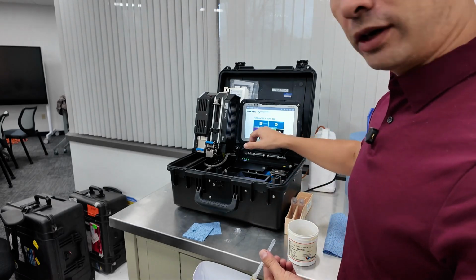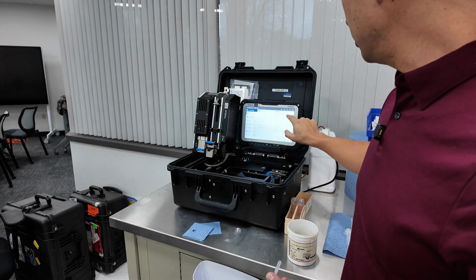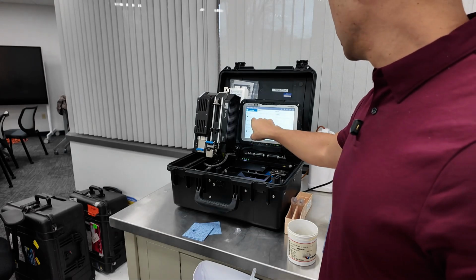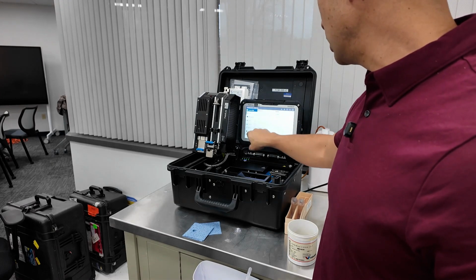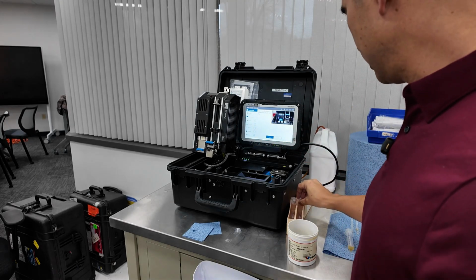We're going to go to, hopefully you can see that, measure fluid. Okay, first the sample. We'll pick up a sample ID. It's kind of like a here's one I prepared earlier type deal. Once we've done this, we don't have to do this necessarily in order, but we are probably going to zero the filtergram just to get it ready.